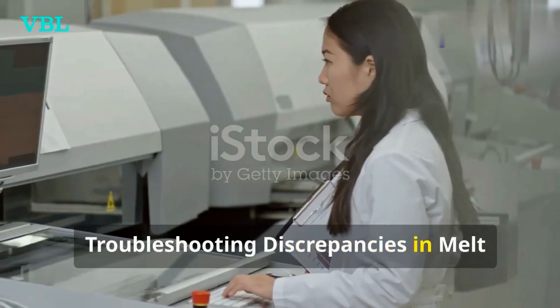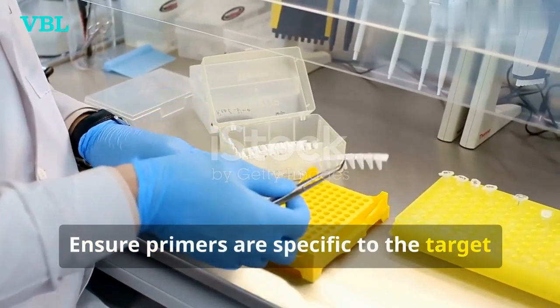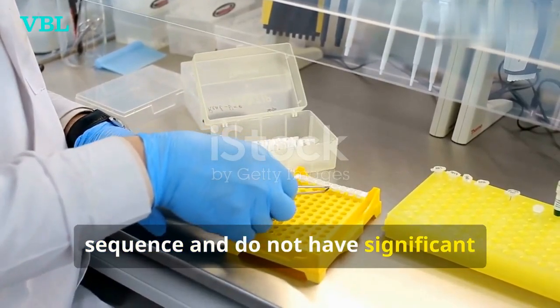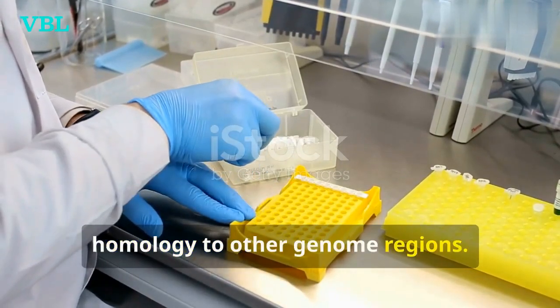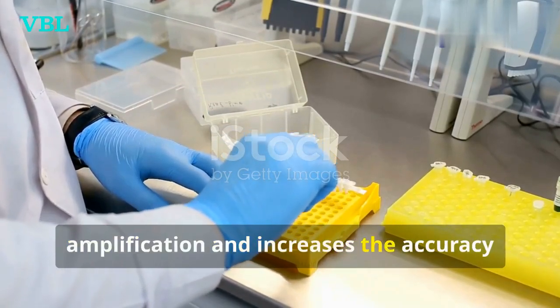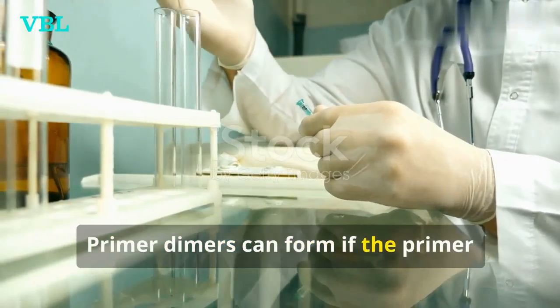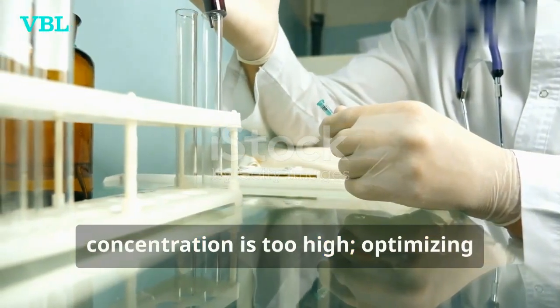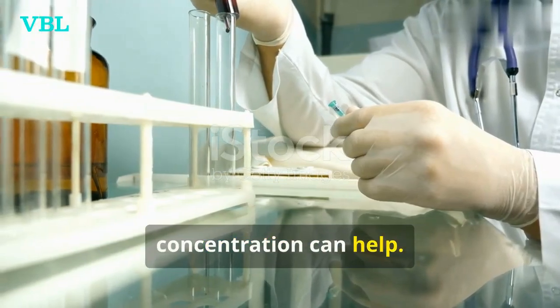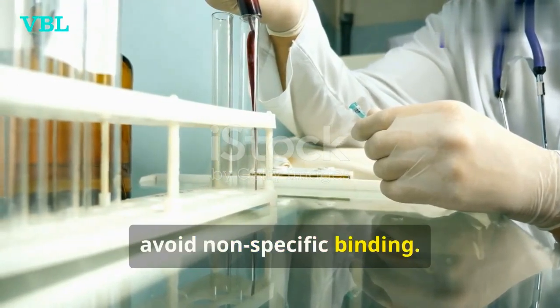Troubleshooting discrepancies in melt curve results. Ensure primers are specific to the target sequence and do not have significant homology to other genome regions. This helps in reducing off-target amplification and increases the accuracy of your results. Primer dimers can form if the primer concentration is too high. Optimizing concentration can help. It's crucial to find the right balance to avoid non-specific binding.